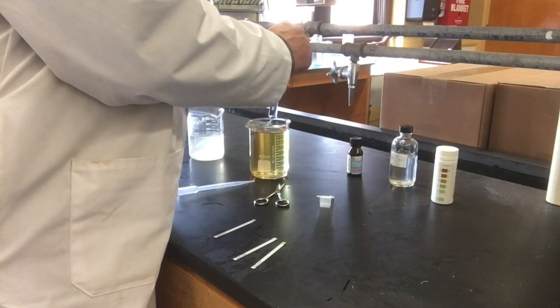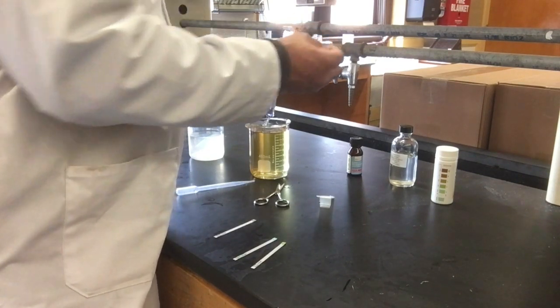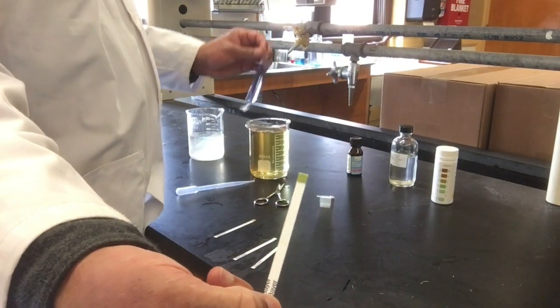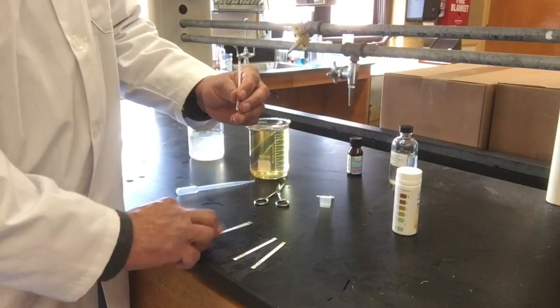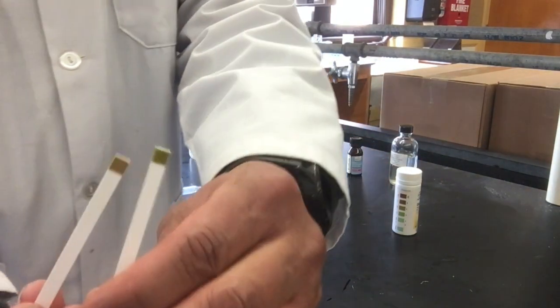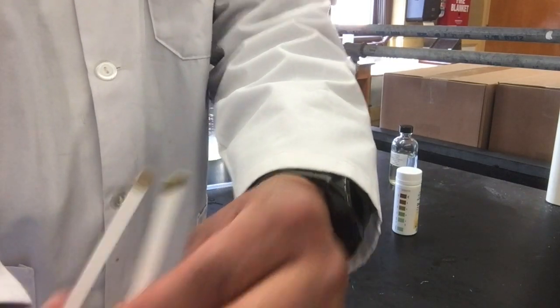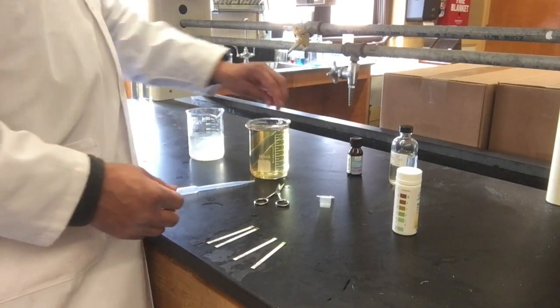Looking at the color, it definitely changed. Comparing to the original bag and color, it's about the same—not quite as dark as the original, but definitely positive. The bag still tests positive for glucose.